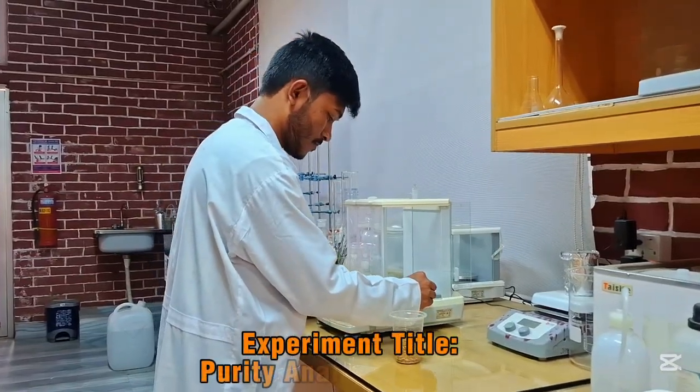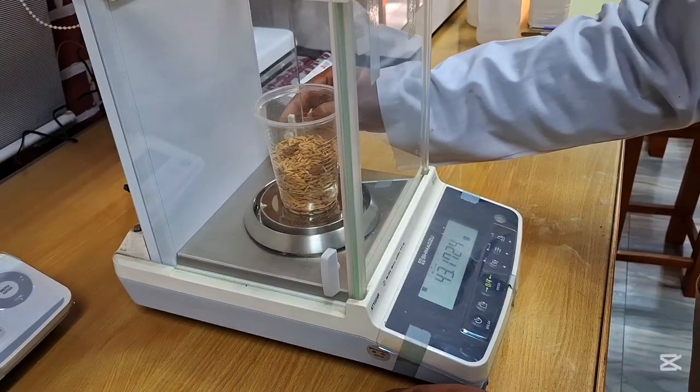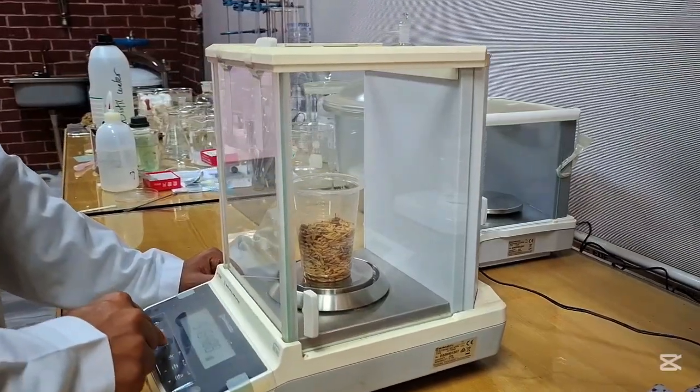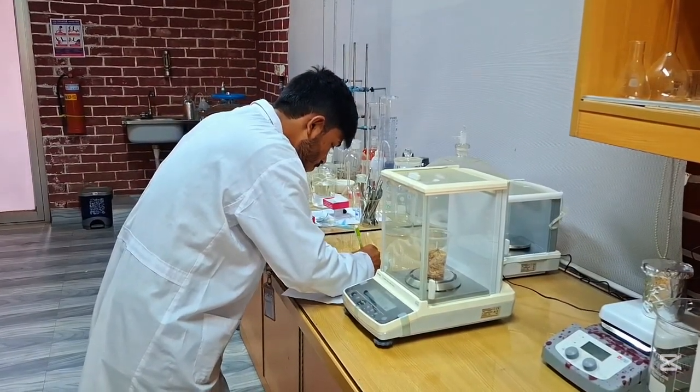The seed purity test is conducted to determine the percentage of pure seed present in a given seed sample. In this test, the seed sample is separated into 3 components: pure seed, other crop seed, and inert matter. Now I am going to demonstrate the procedure of the seed purity test. First, pure seed, inert matter, and other crop seed were taken together in a glass container and weighed using an analytical balance.